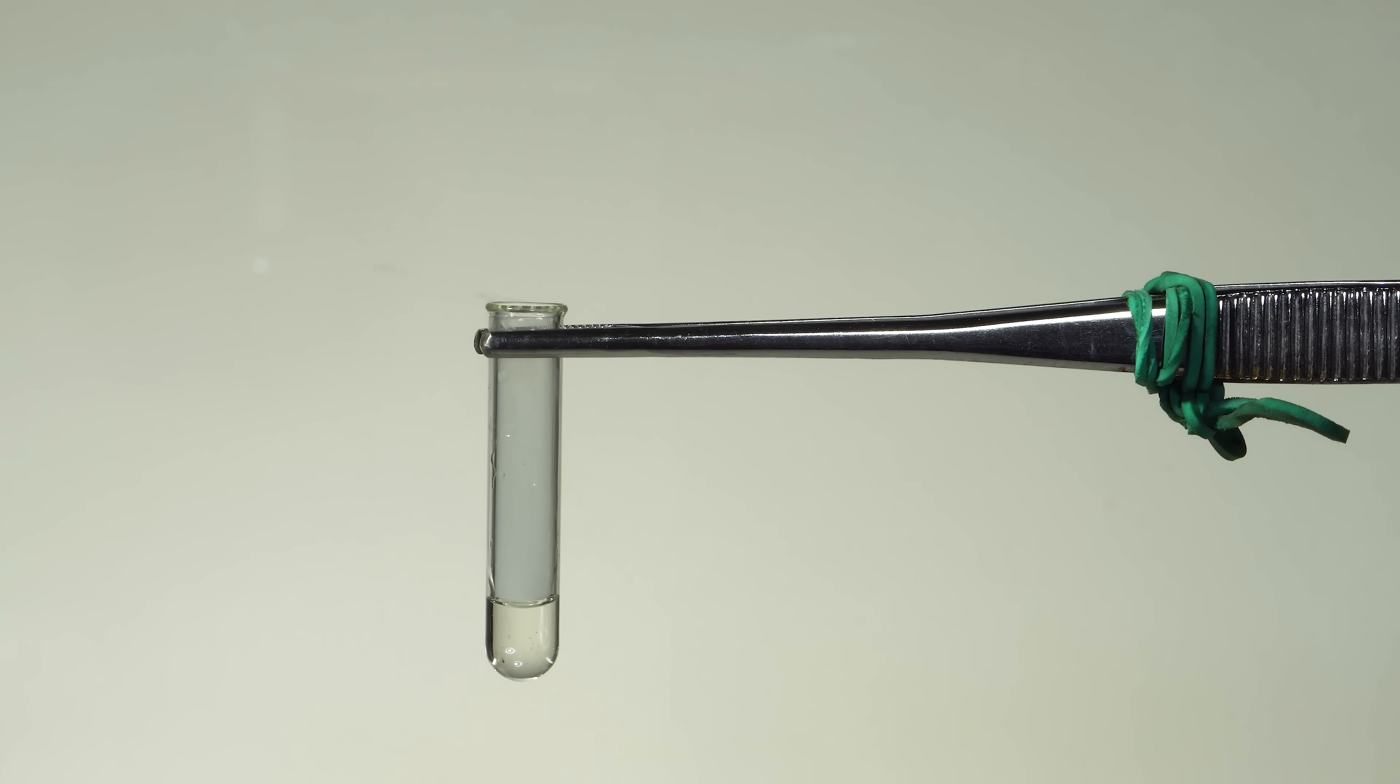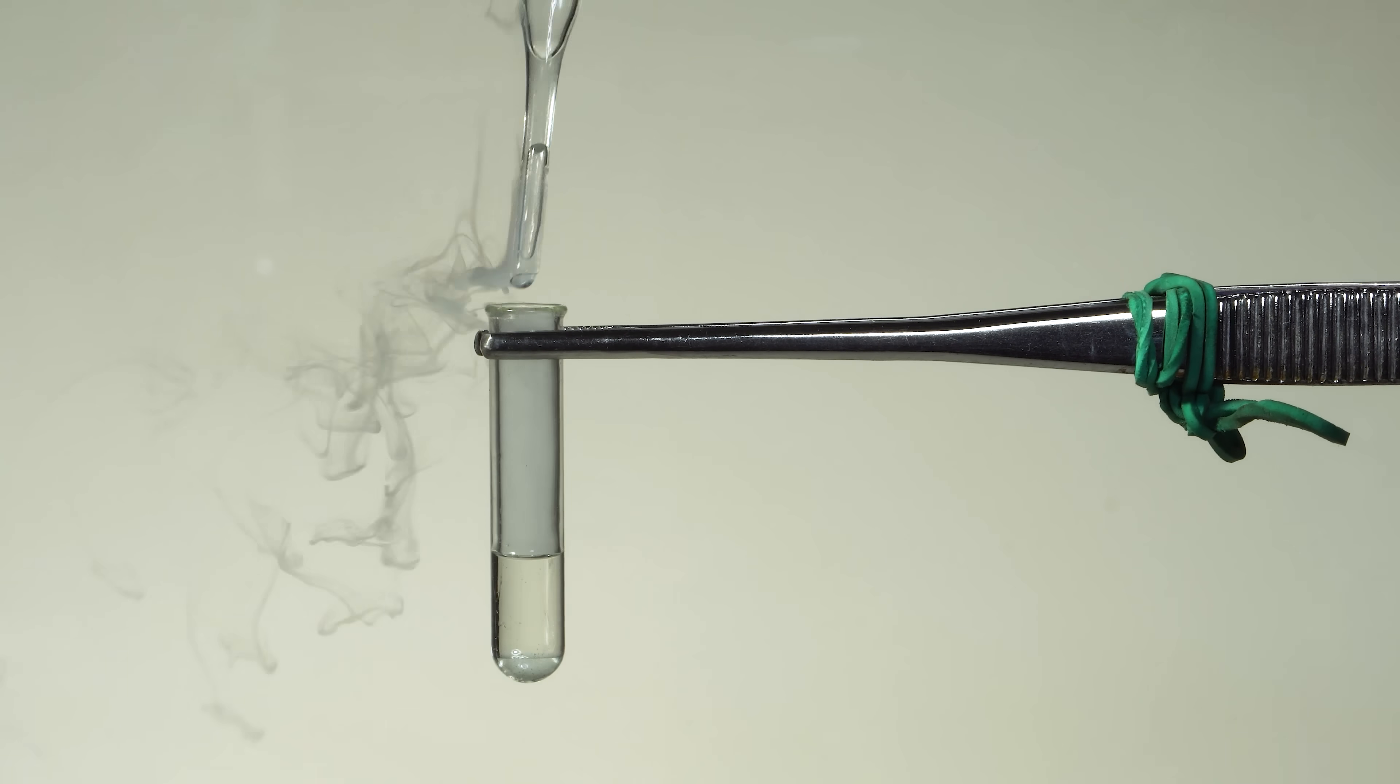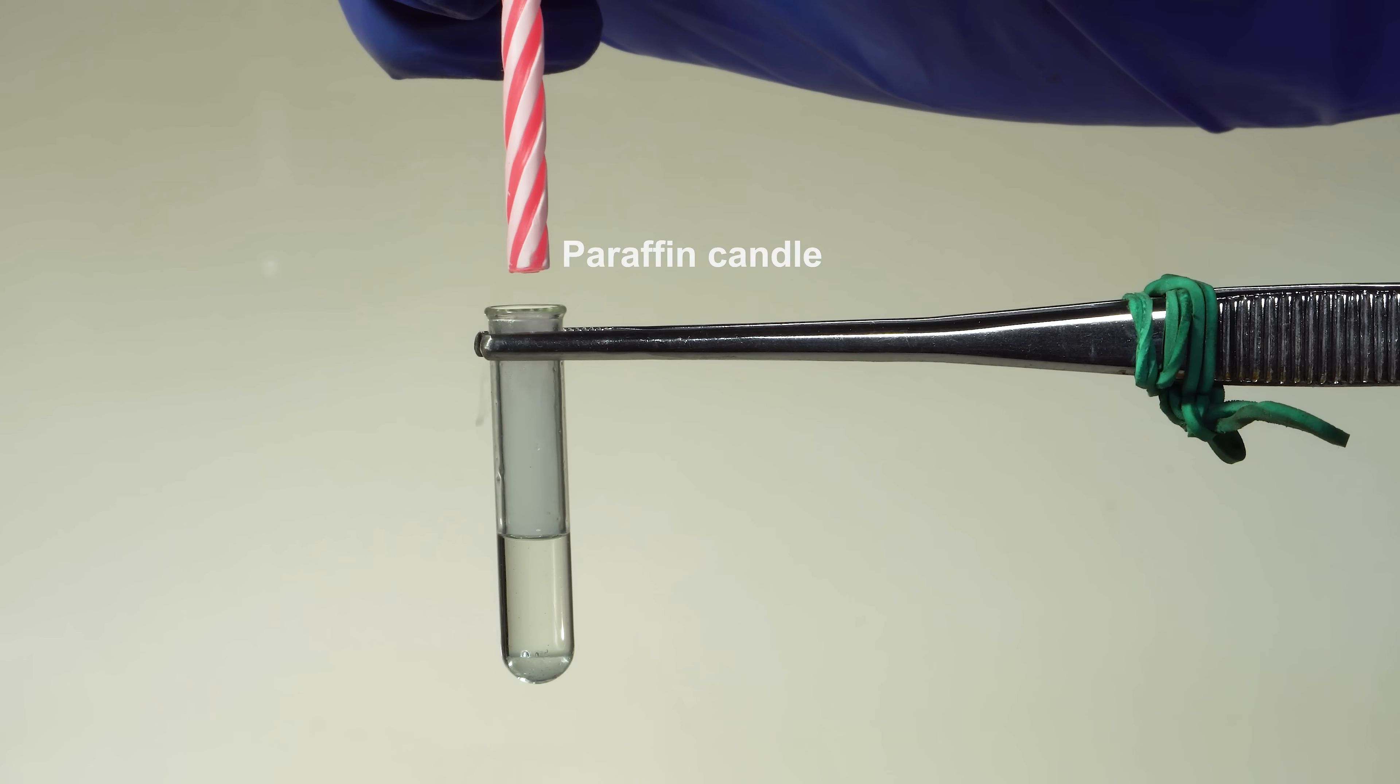Having mixed antimony pentafluoride and fluorosulfuric acid, we produced magic acid. Well, let's dip a paraffin candle in it and see if anything happens.